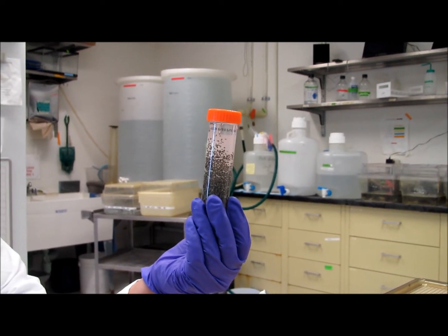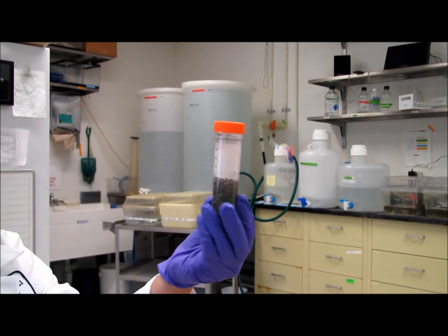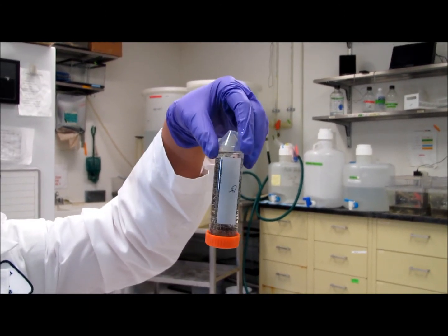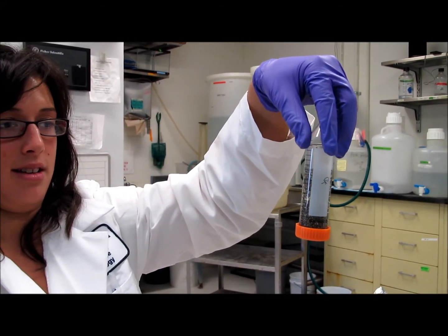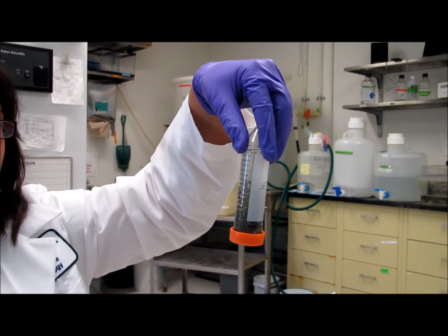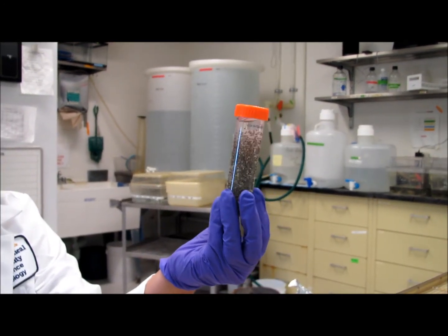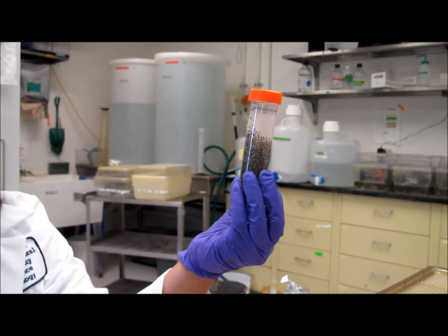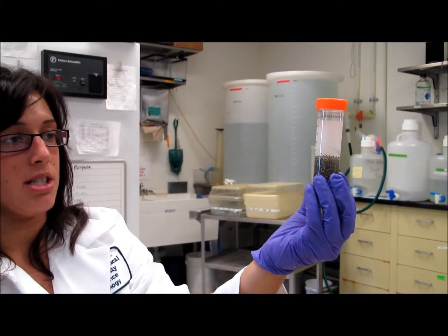So how many times do you need to invert? A good indication of the jelly coat being removed is half the mils of collected eggs. For example, if you start out with 20 mils, usually it will be between 12 to 10 mils after de-gelling.